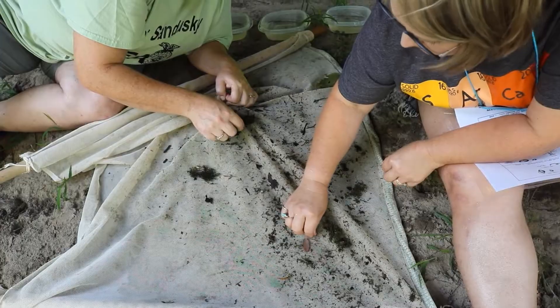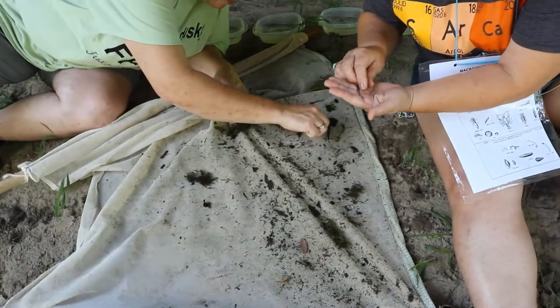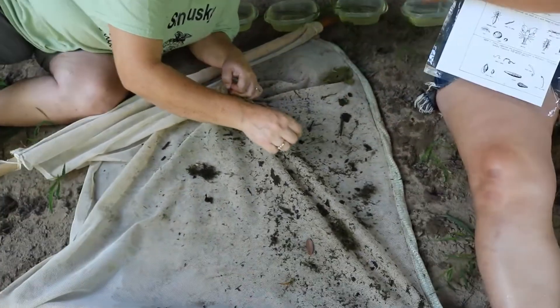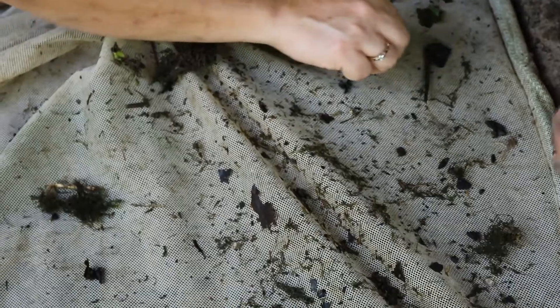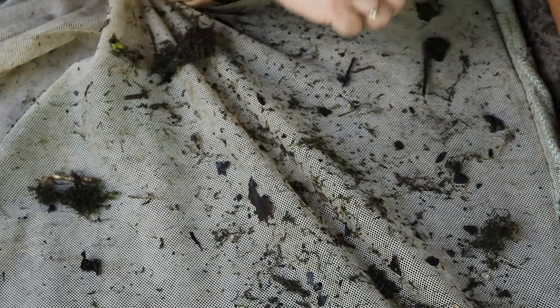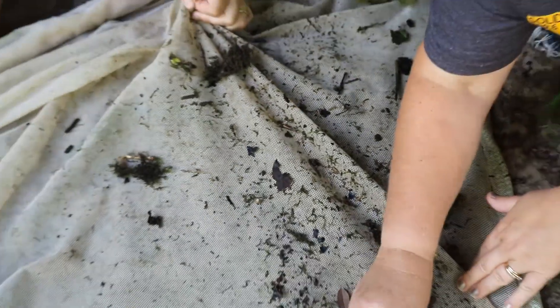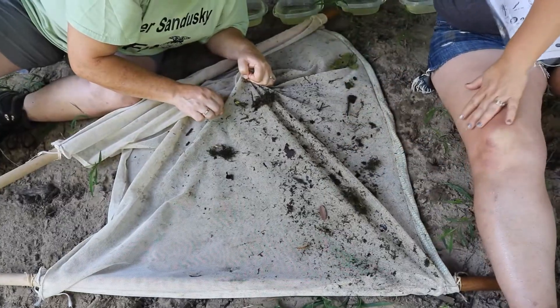This looks like it might be a mayfly. There are a lot of them — these have got to be mayflies. I think that's a mayfly. I'll put him in group one, and if he's wrong I'll move him. He was small so I couldn't see his tails at first. That's why you've got to get him in the water — then they're easier to see.